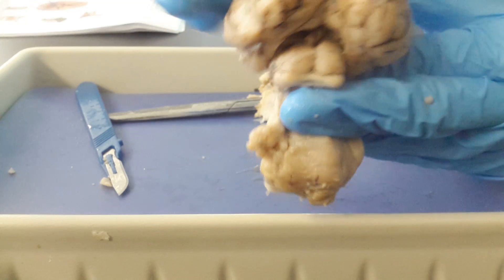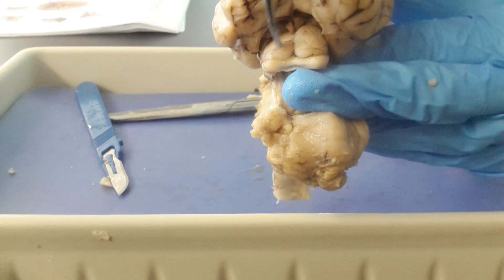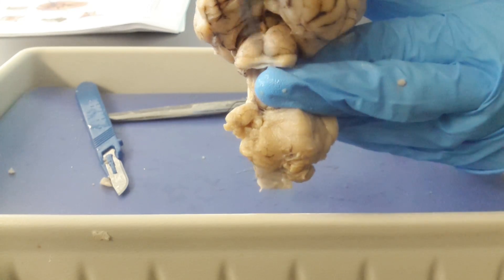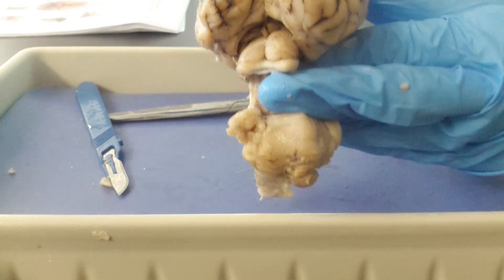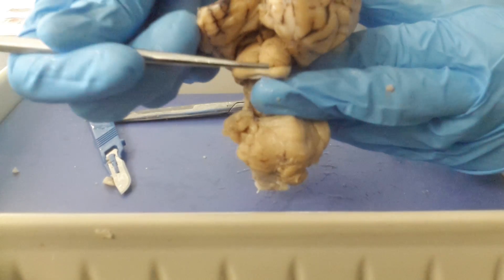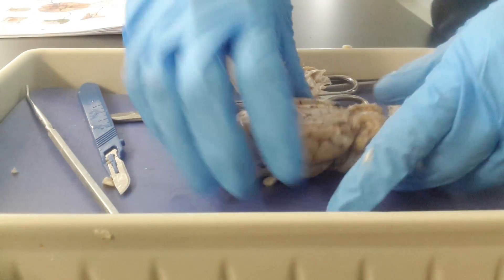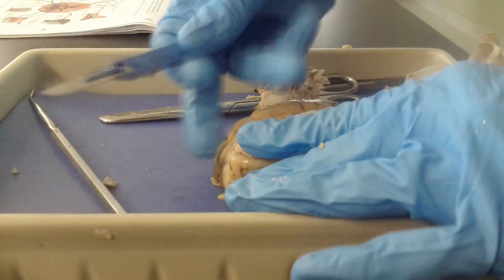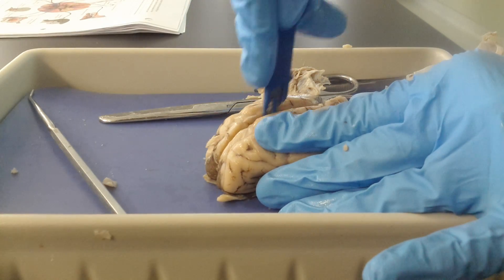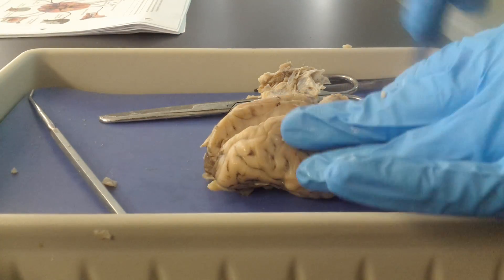Remember, the colliculi are masses of gray matter or neuron cell bodies. These top two larger protrusions are the superior colliculi. The bottom two are the inferior colliculi — so singularly, this is a superior colliculus and this is an inferior colliculus. Now what we're going to do is go ahead and cut down the longitudinal fissure to slice the brain into left and right halves so that we can see some of the internal structures.